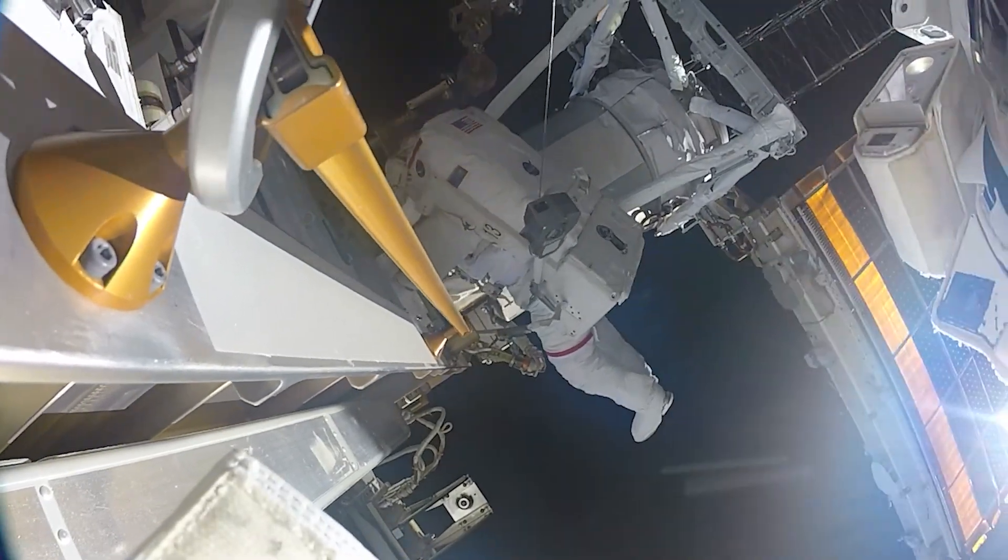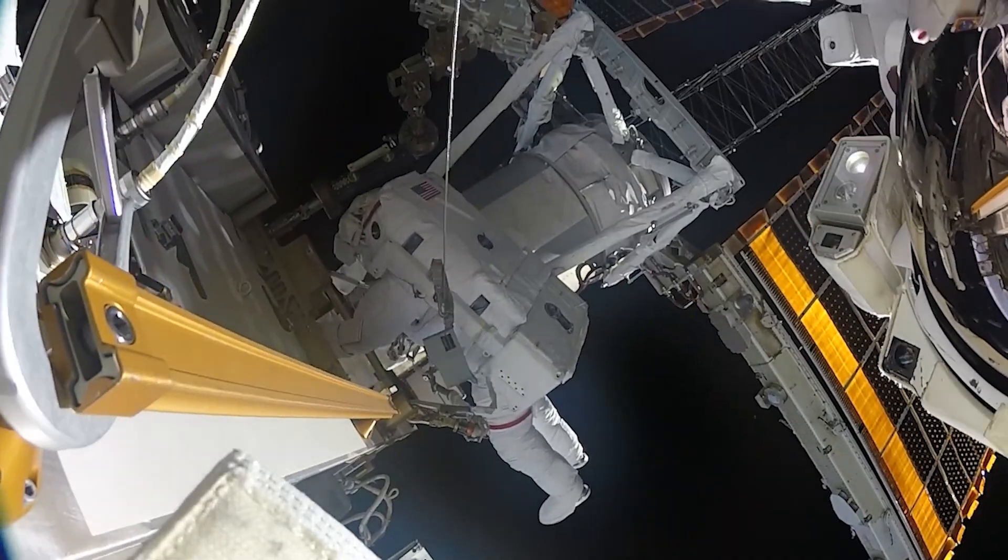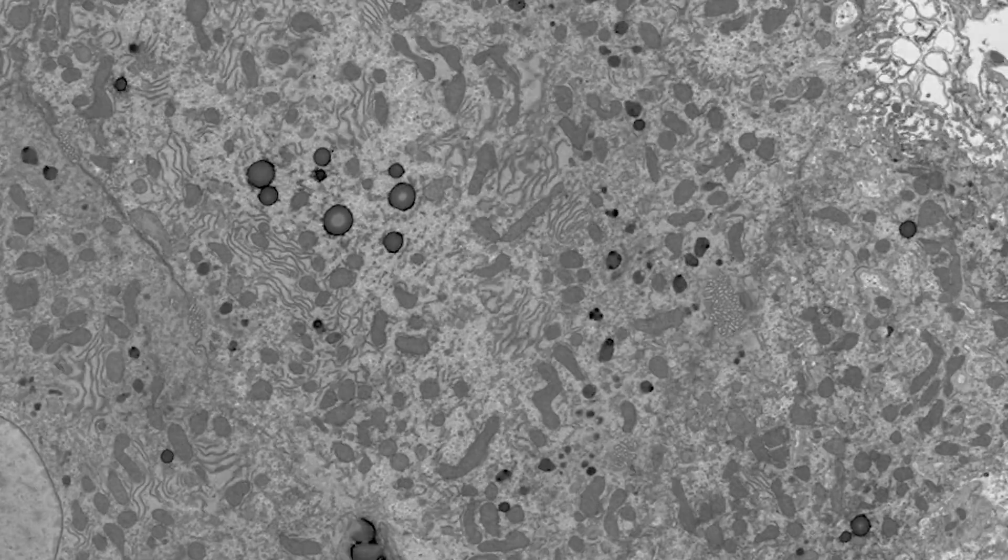It's very difficult to put a biological sample into an electron microscope. If we went into space without protection we would implode, explode, or boil — which is what happens to cells in a vacuum — so we protect them in resin. Biological samples are made of carbon, hydrogen, and oxygen and don't have much contrast, so we use heavy metals like osmium, lead, and uranium, which bind to the membranes in cells and tissues. When electrons hit them they scatter, and we can produce an image.